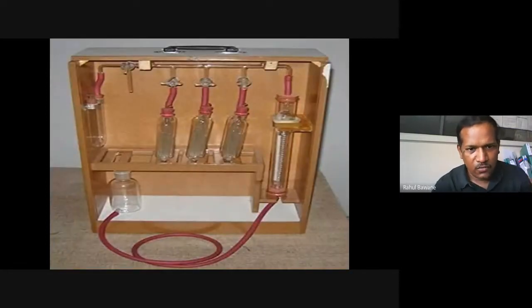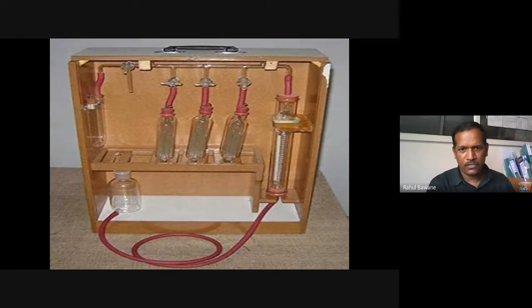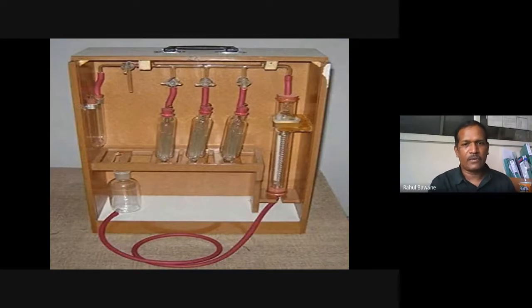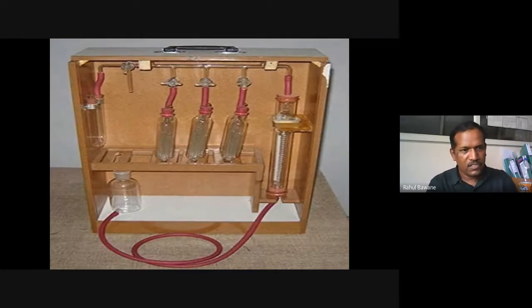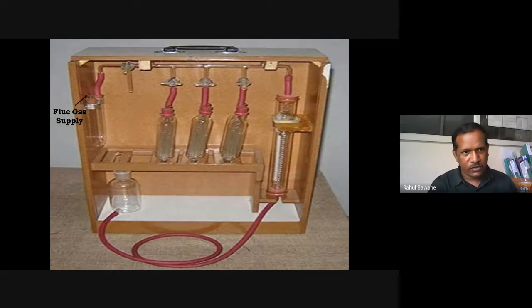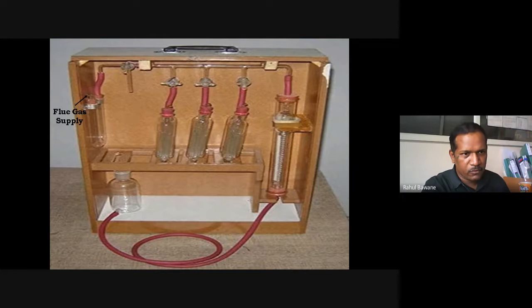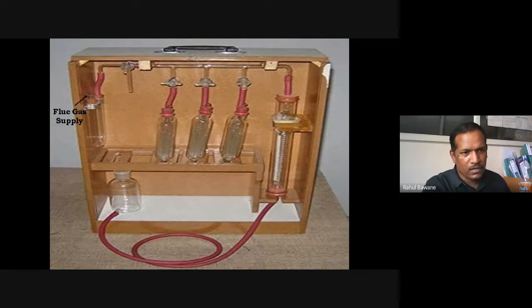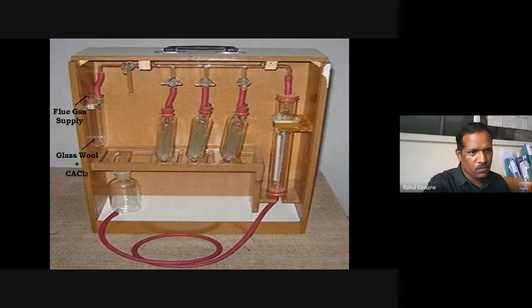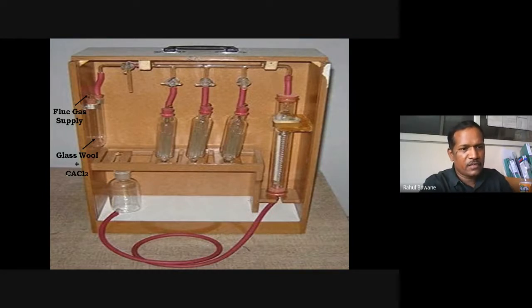Let us see what the apparatus looks like. This is the Orsat apparatus. There is a flue gas supply inlet provided. Whatever flue gas is there, we attach that pipe here to this U-tube — a glass U-tube. Inside this glass U-tube there is glass wool and calcium chloride.